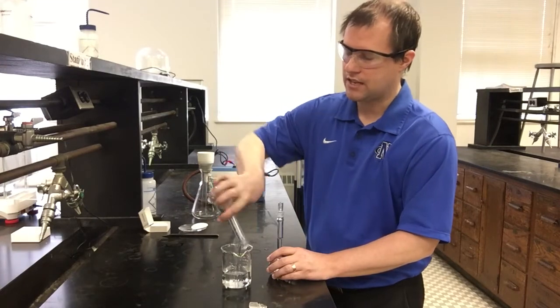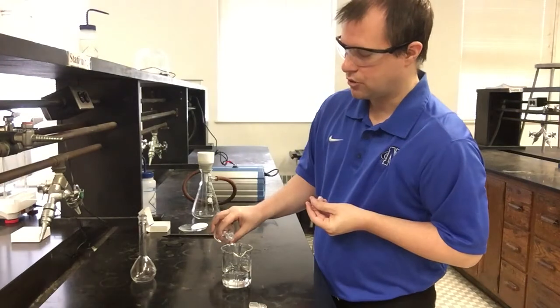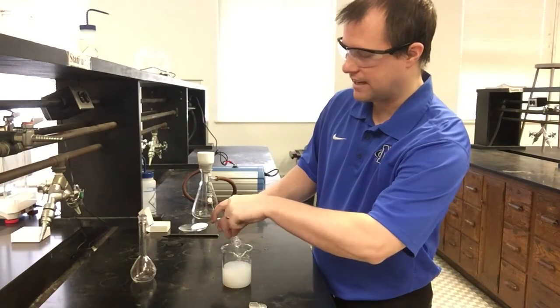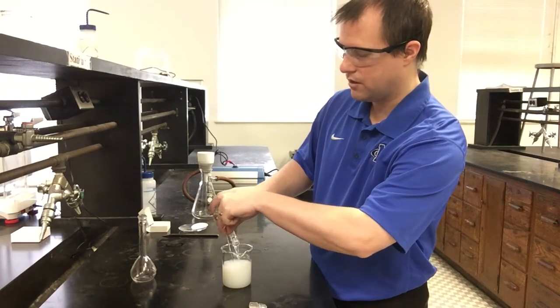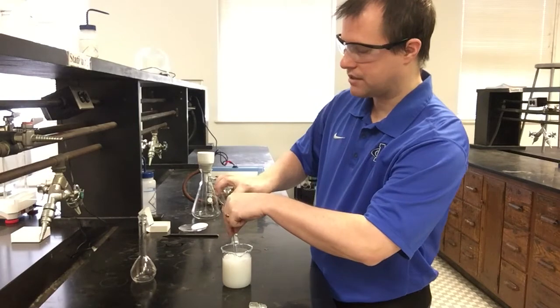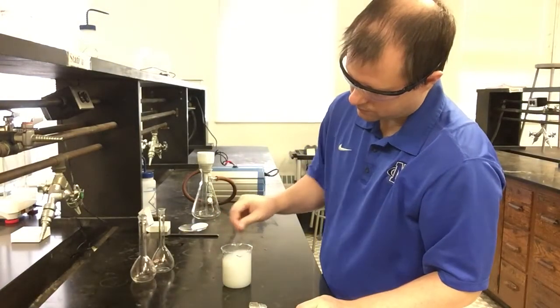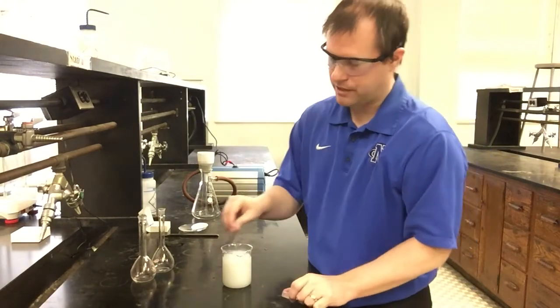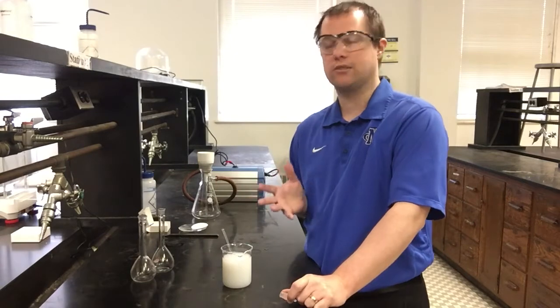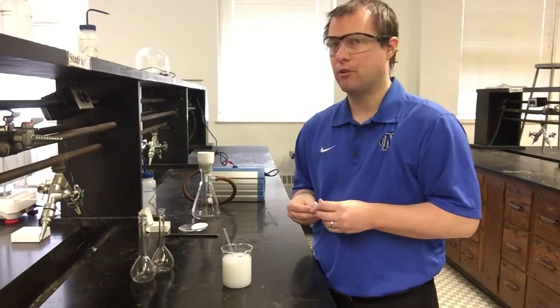So I'll add all of its contents, and then next I'm going to do the same thing for my sodium carbonate solution. I'm going to add all of it, and immediately upon me starting to add these things, you already see the precipitate form. Right? My solution is now very cloudy and white, and I'm going to mix this up really good here just with the stirring rod, just to get as much of the reaction to happen as I possibly can. But the fact that you can already see how cloudy white that solution became instantly upon adding that sodium carbonate, that's pretty typical for most precipitation reactions.